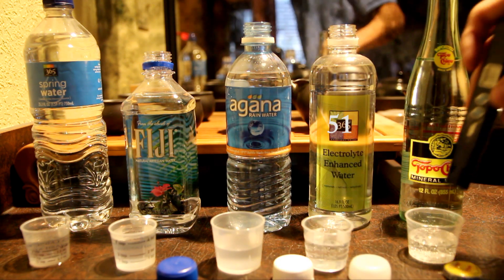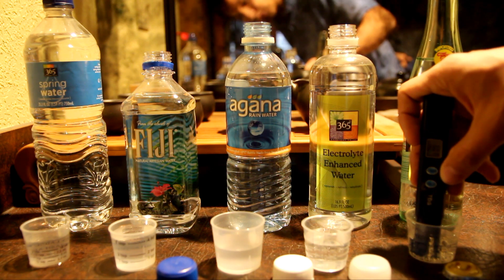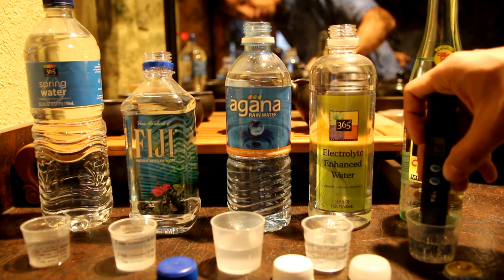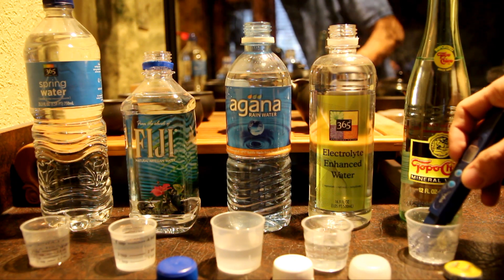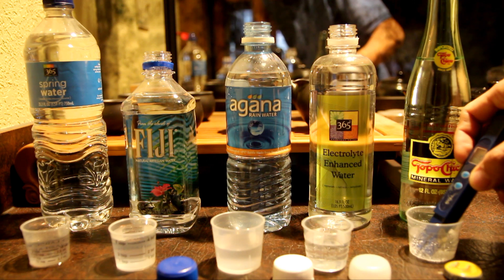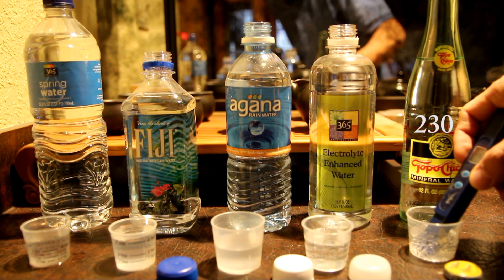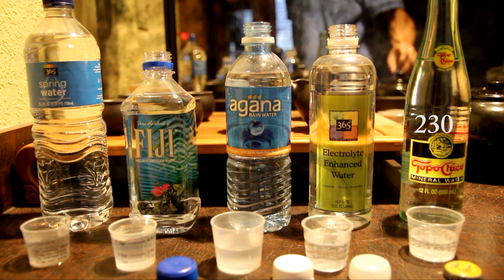Finally, mineral water — 300. Actually this is all over the place because I guess it's bubbling. There we go. Interesting — 230. So there you go.